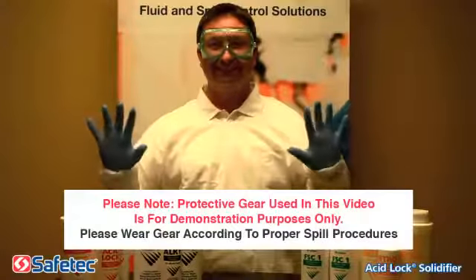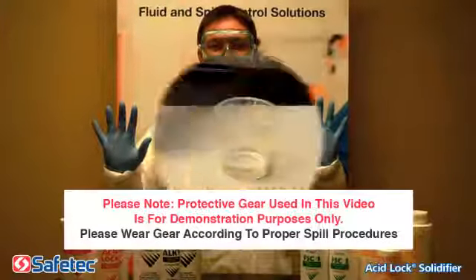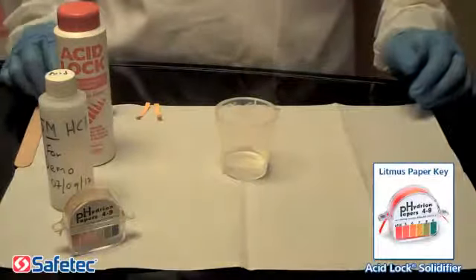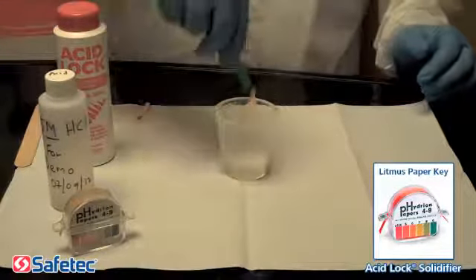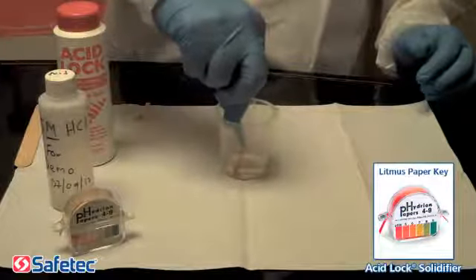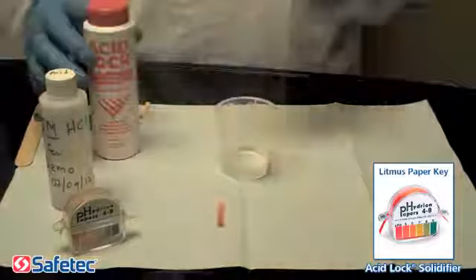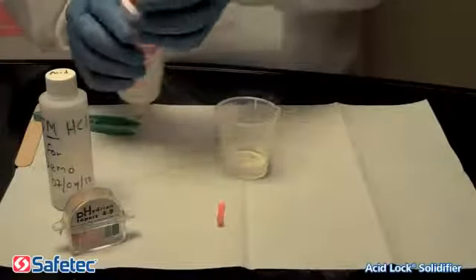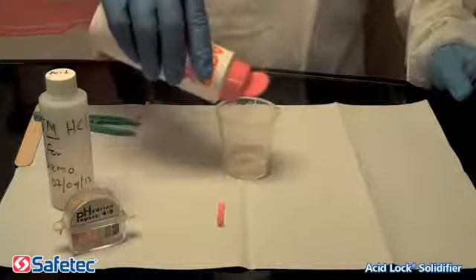Step 1. Remember to always wear protective gear and exercise caution during cleanup. Step 2. We will begin by using our litmus paper to test the fluid and show the low pH level. Step 3. Flip open one side of the top and pour Safetec's Acid Lock onto the acidic fluid.